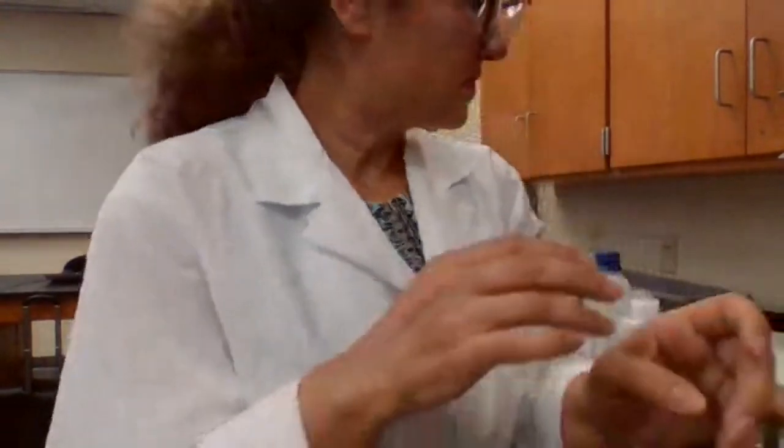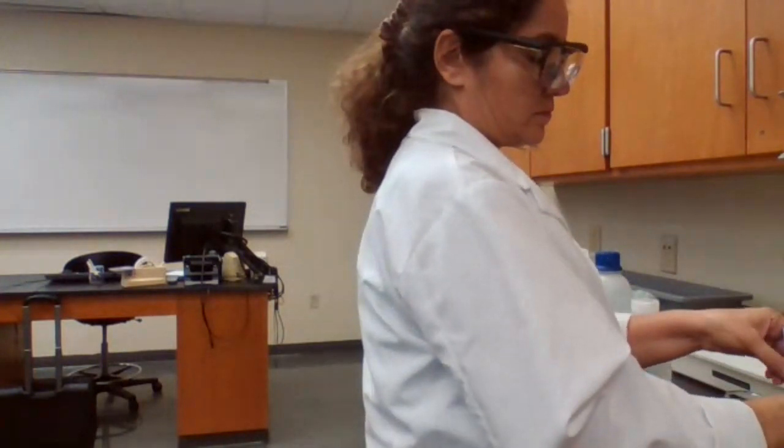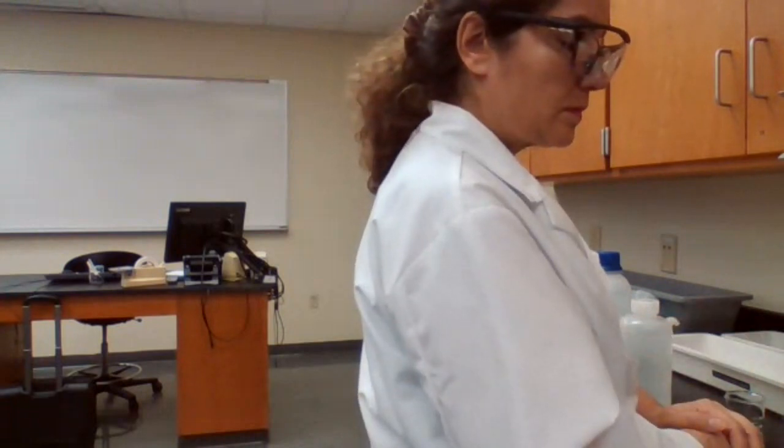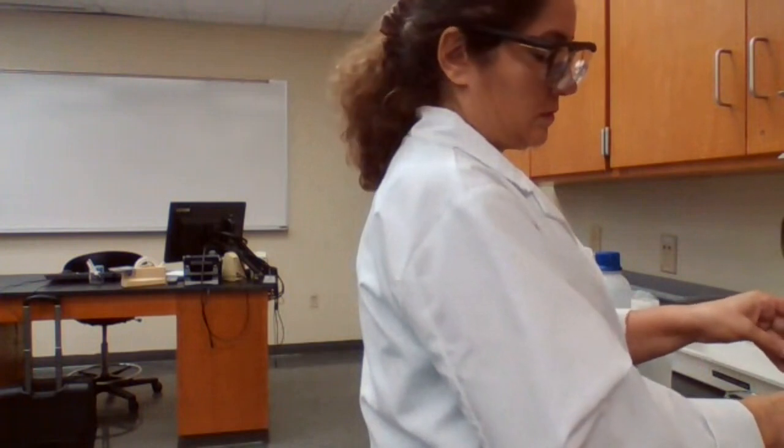17 milliliter, pH equals 5.1. 5.26 for 17.5. 18 milliliter, pH equals 5.46.